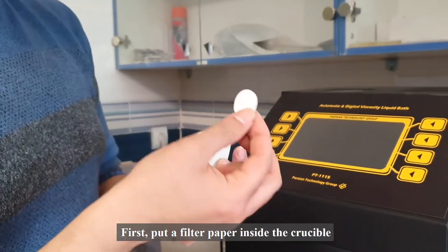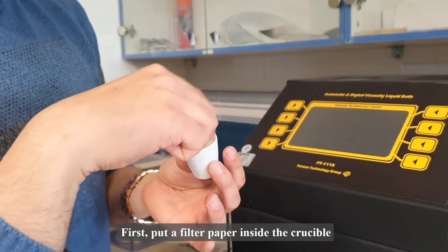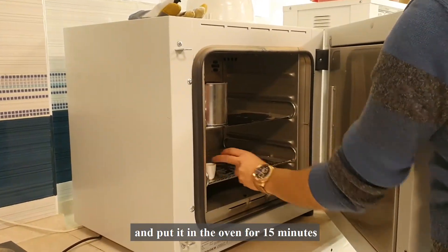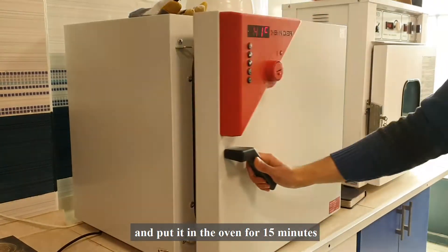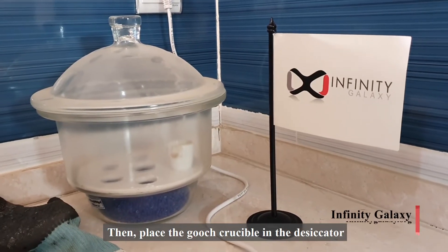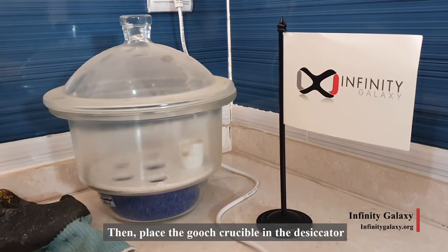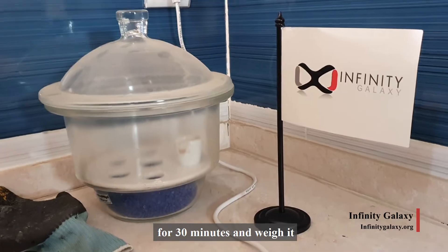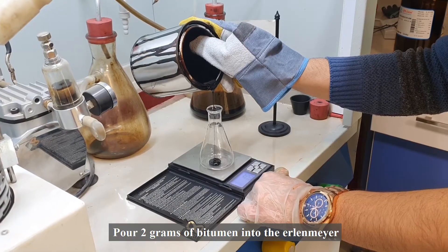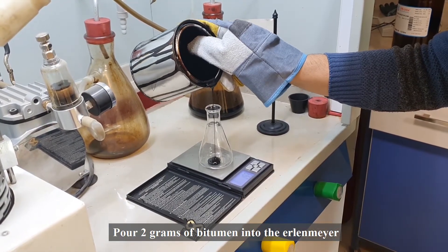First, put a filter paper inside the Gooch crucible and put it in the oven for 15 minutes. Then place the Gooch crucible in the desiccator for 30 minutes and weigh it. Pour 2 grams of bitumen into the Erlenmeyer flask.